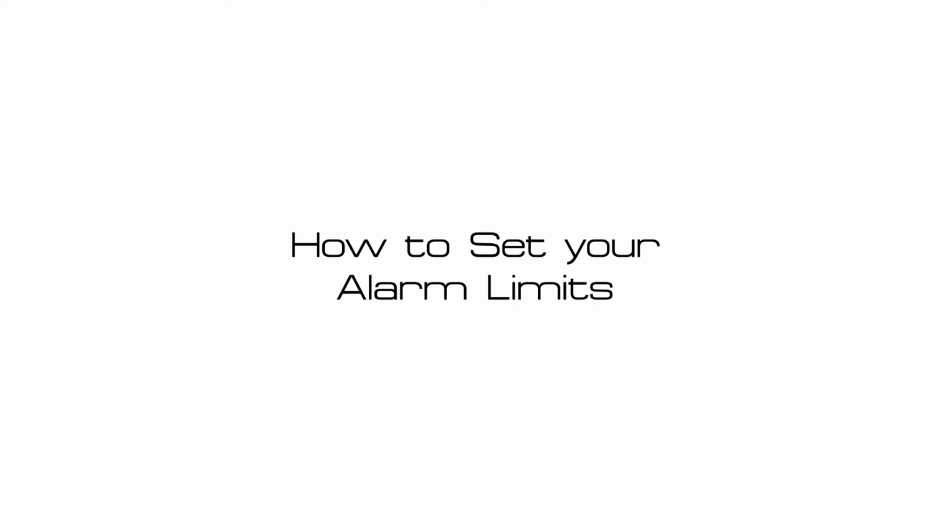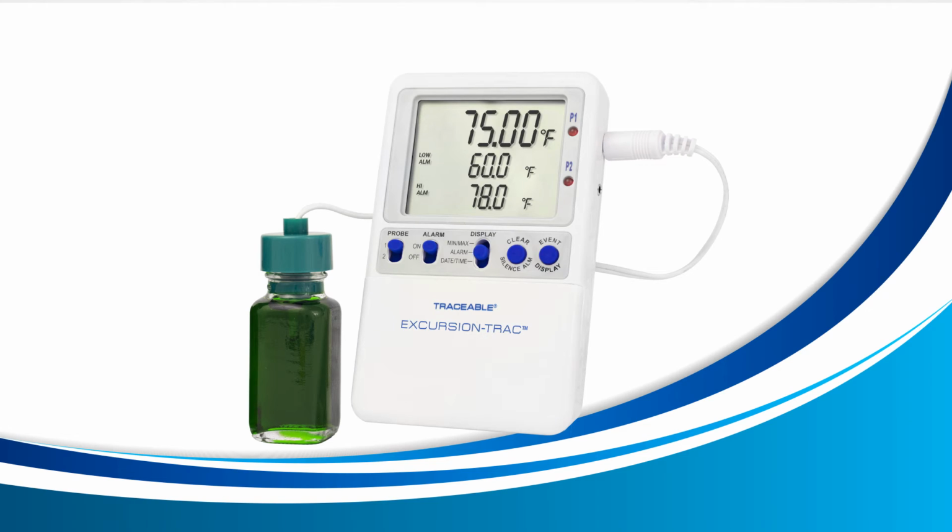How to set your alarm limits. Before we begin setting your alarm limits, we'll need to do three things. First, we'll select the probe we want to set our alarm limits for. In my case, I only have one probe connected to my device in the P1 slot. So I'm going to leave the probe switch on the left to the number 1 position.